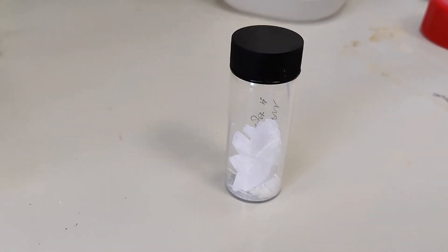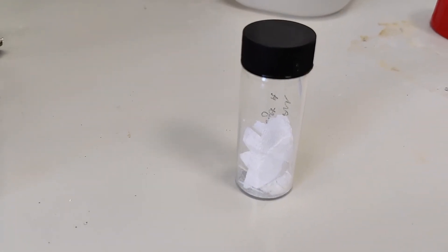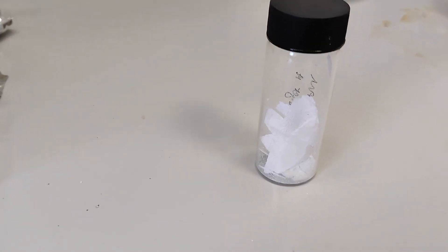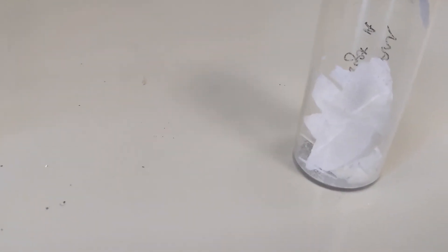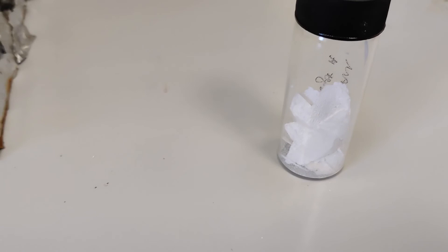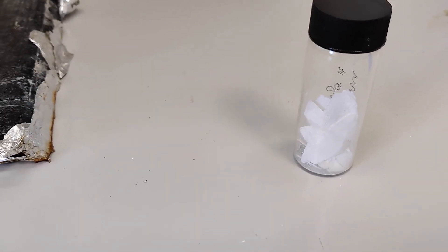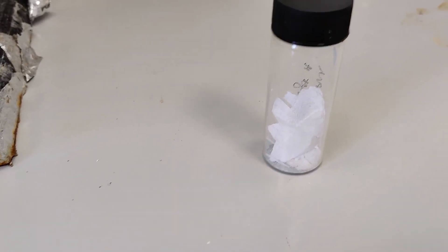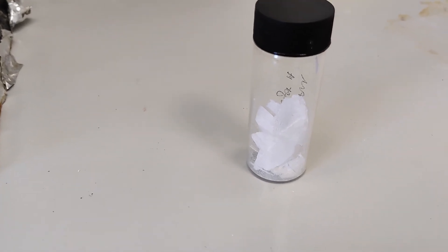Having now filtered the triturated product to remove the ethyl acetate and any impurities in it we've managed to isolate a nice white solid fluffy product which might look like filter paper but is in fact your product. You'll now want to characterize this but you've finished making target A.